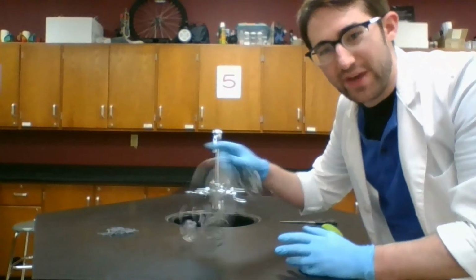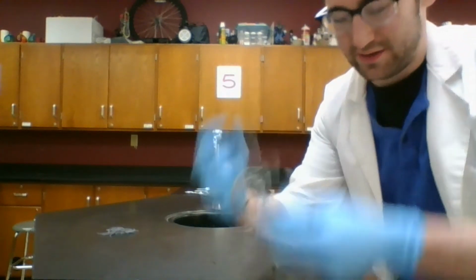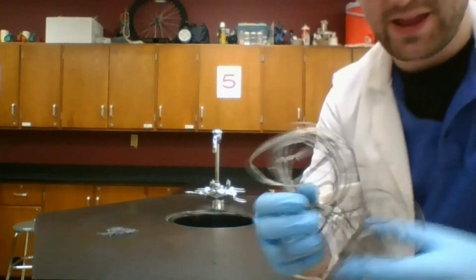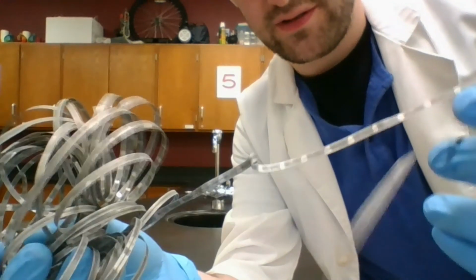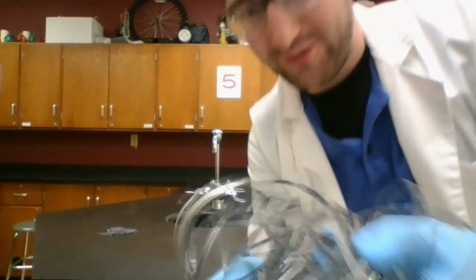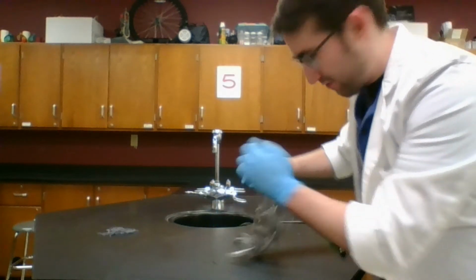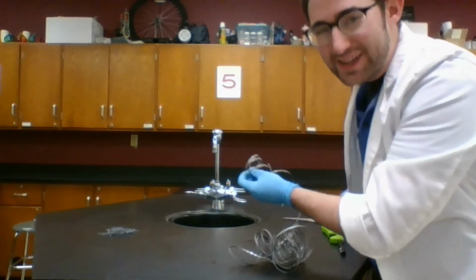This is magnesium metal. In this case, we've got it as a big ribbon. Okay, kind of pull out pieces like this. Like most metals, it is kind of gray and shiny. It's also pretty flexible, so it can be reworked into different shapes. But unlike some metals, this is also able to be cut pretty easily.